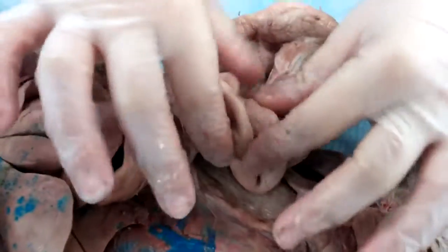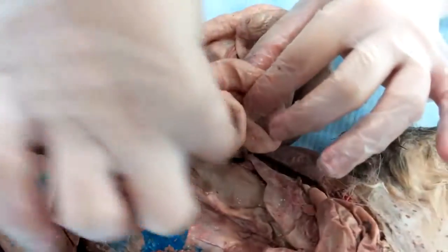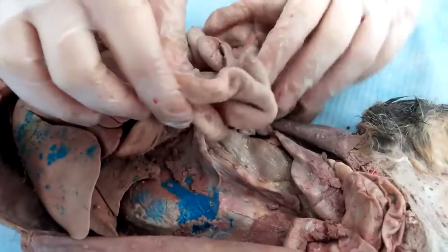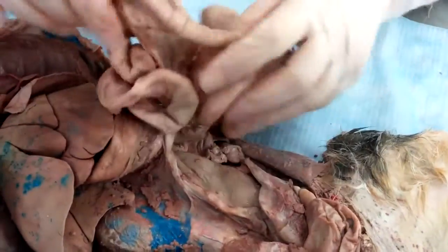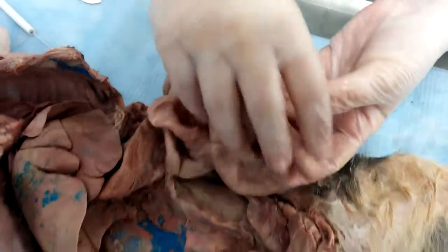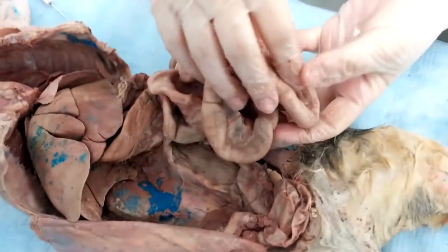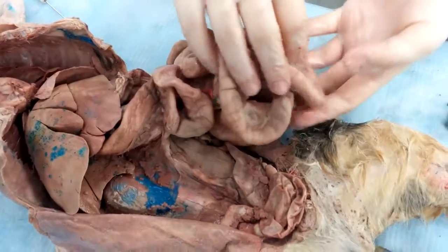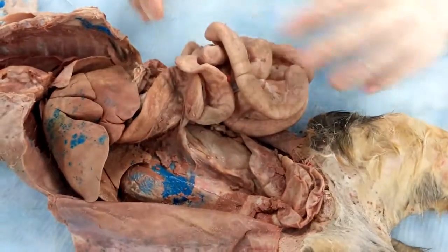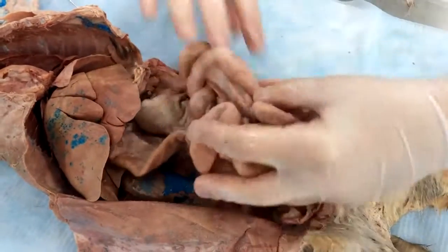This part forms like a J. Then the rest that you see here is the small intestine — it's the ileum. Now we're going to move on to the colon, so we're going to flip this over.